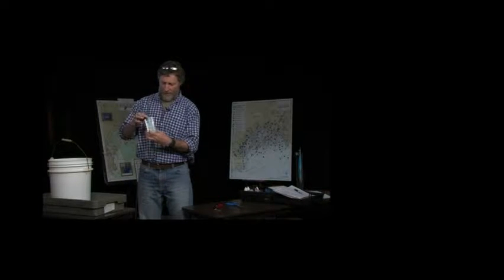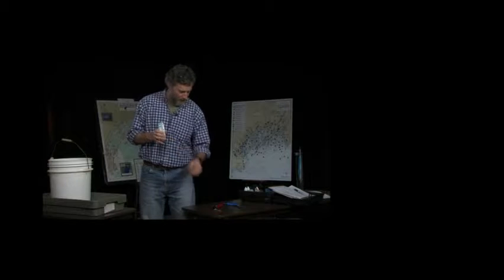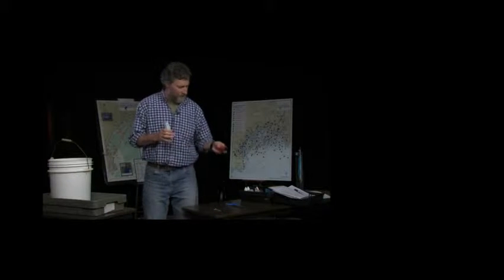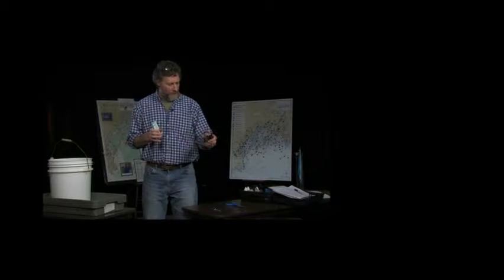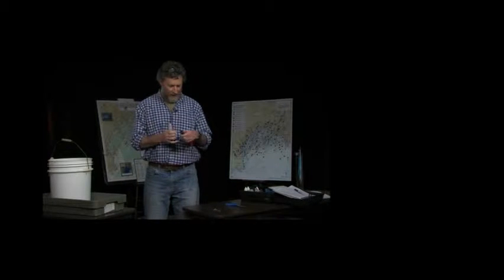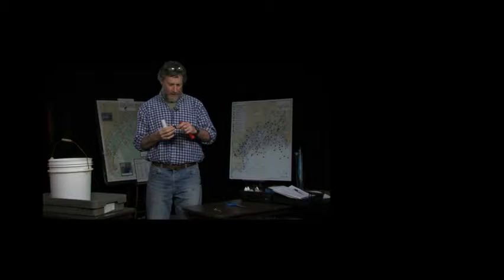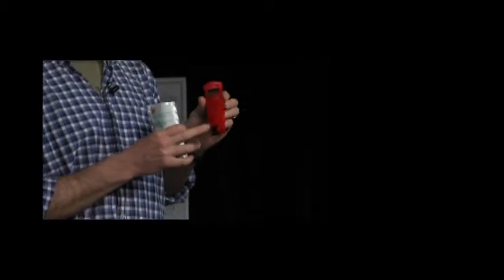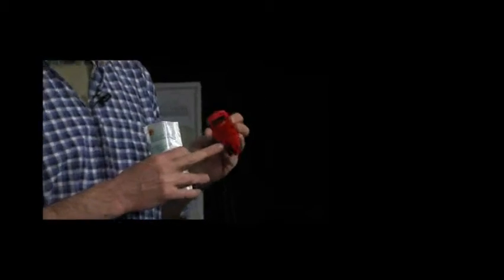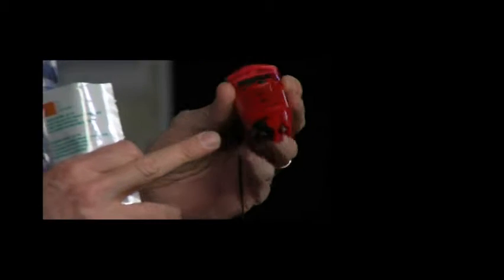Open up the packet and we'll take off the cover for the meter. On the meter there are two sensors. There's a black sensor here that has a glass probe in the middle that actually measures the pH.